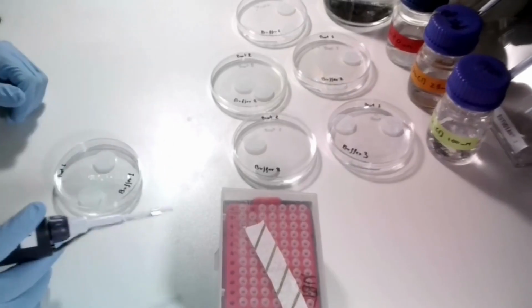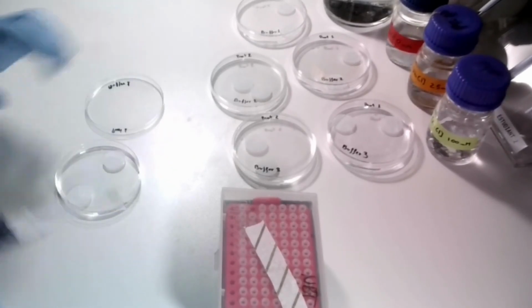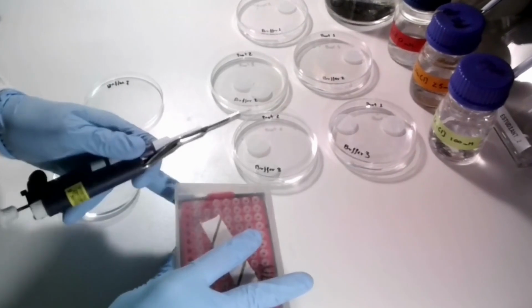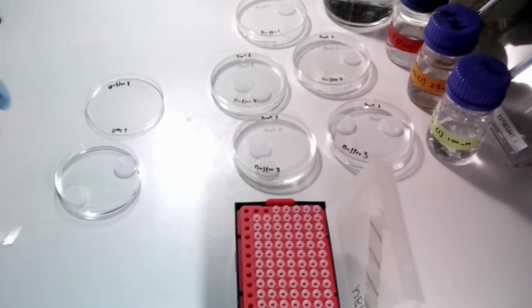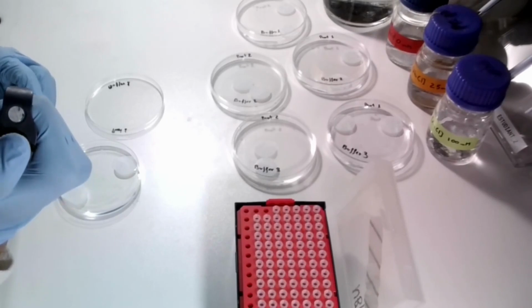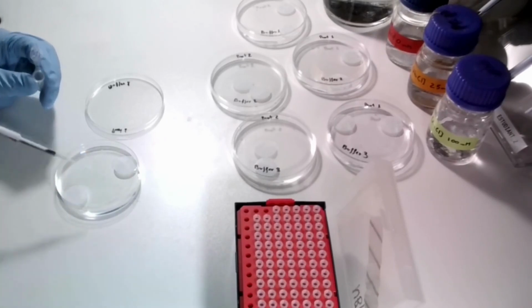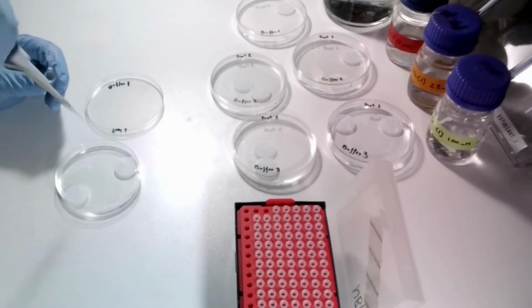For each filter you can microdialyze around 60 microliters in drops of 10 microliters each. So what you have to do is set the pipette to 10 microliters and then dispense on the filters the 10 microliter sample in individual drops. You can load more than 1 drop per filter. If you separate them conveniently, you can even load around 6 or 7 drops on each of the filters.